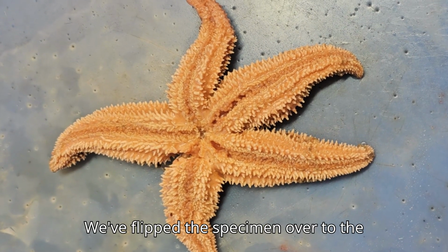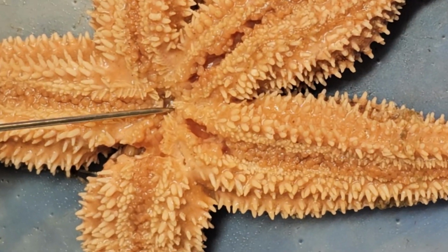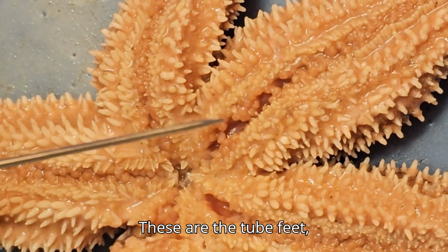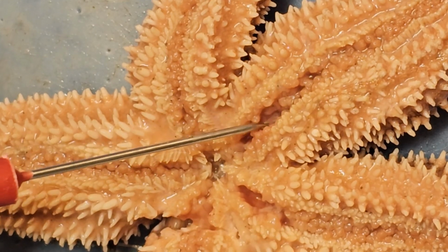We've flipped the specimen over to the oral surface, and so now we're looking at the mouth. These are the tube feet, and the tube feet are housed in the ambulacral groove.